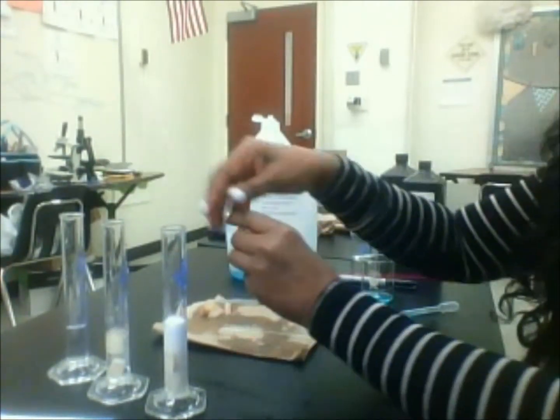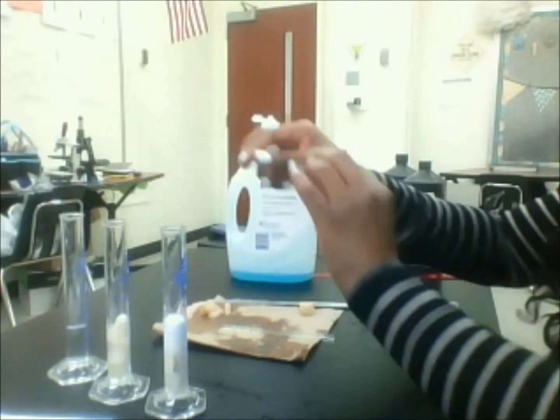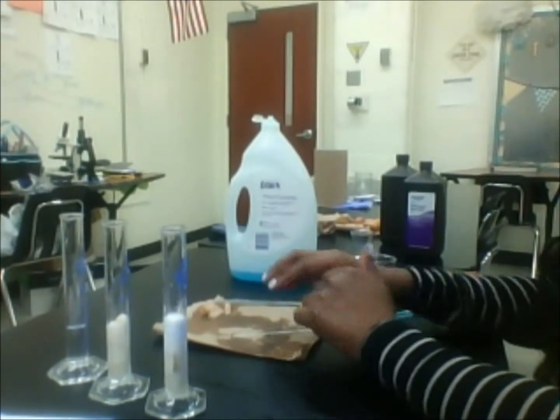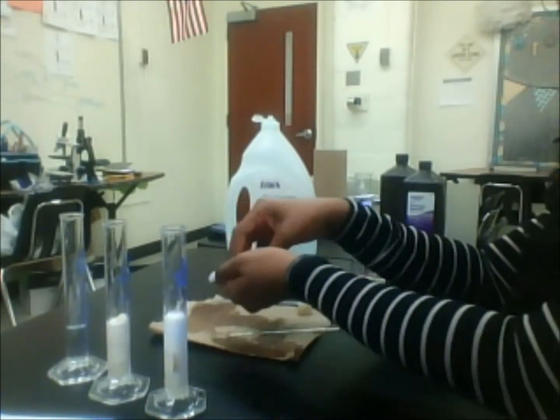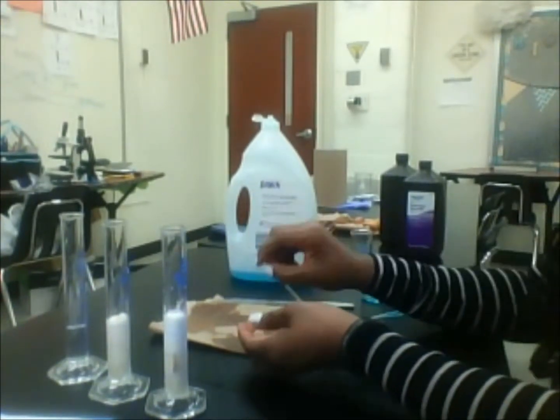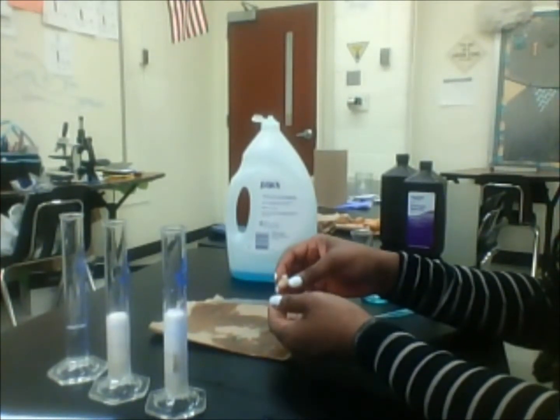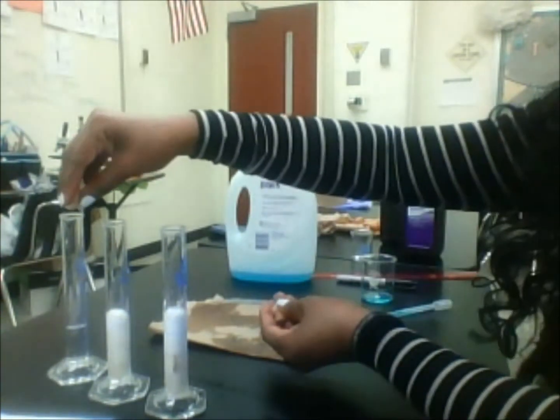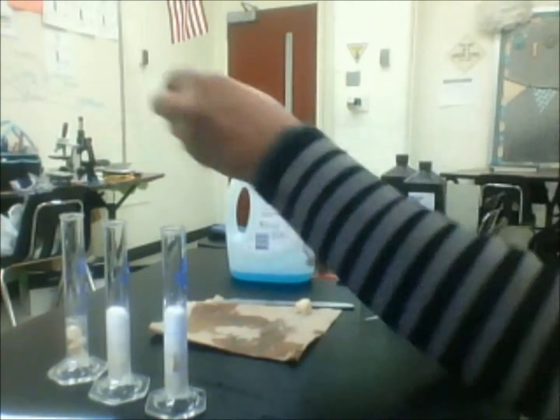So a little bit more than 30 seconds. It's about 33 seconds. I put that one in. So that was the one in quarters. And then next we're going to have the one that we cut in eighths. Alright, and it's about 30 seconds now. So I'm going to drop that.